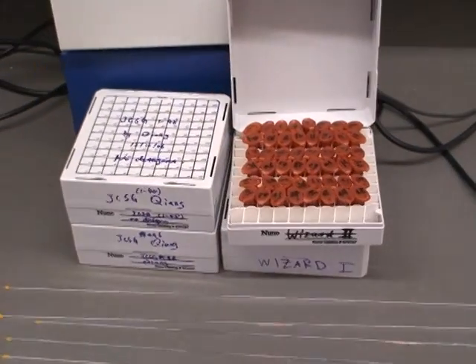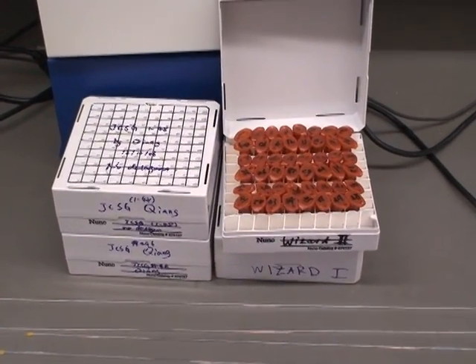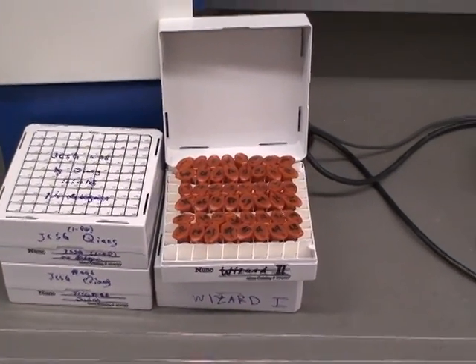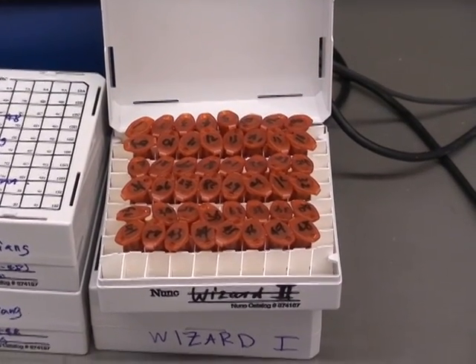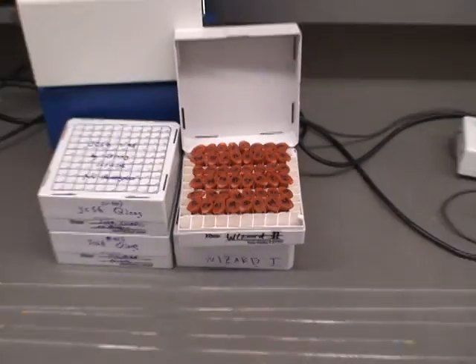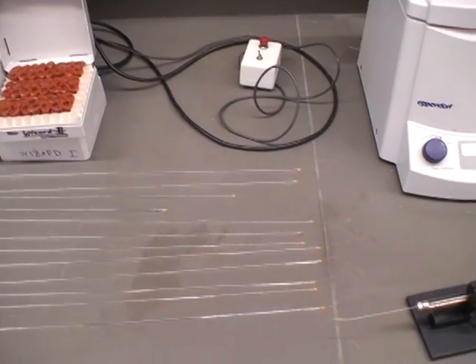Up here we have the screens, there's just four screens that are used, and maybe a milliliter of each solution is put into Eppendorf tubes just for organization, for when the cartridges are formed.